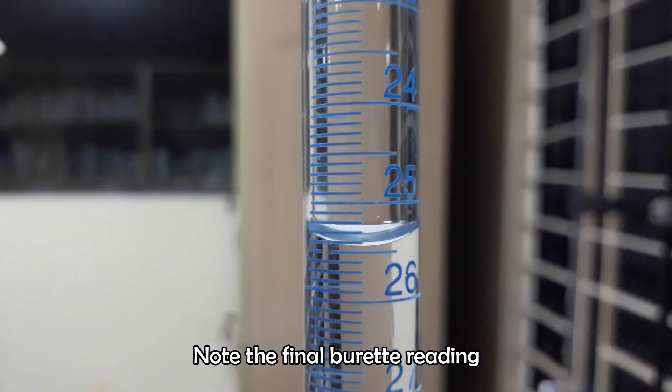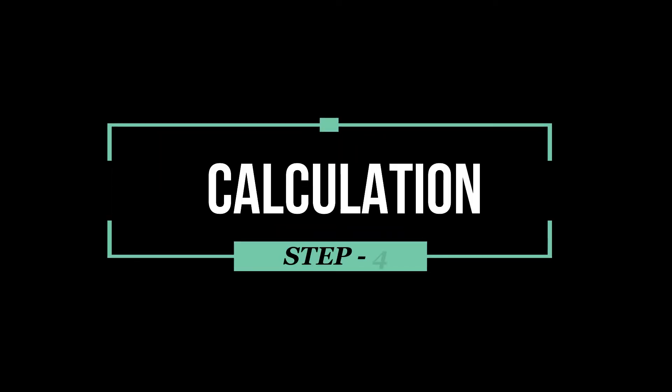Note the final buret reading. Now we are going for the calculation.